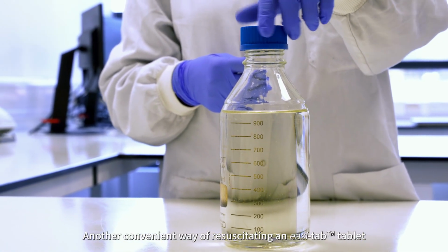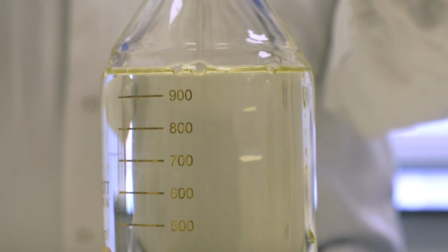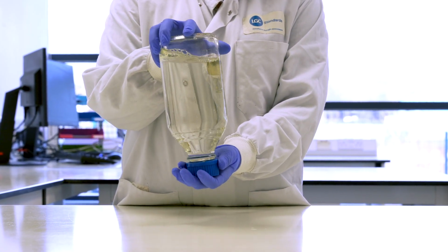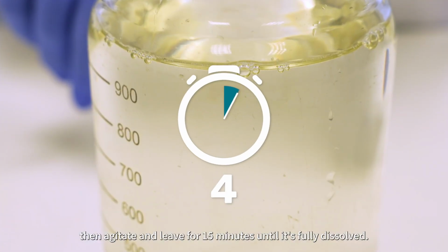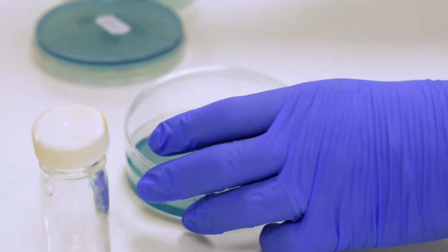Another convenient way of resuscitating an easi-tab tablet is to add it directly to any larger volume of liquid that suits you. For example, you can take 1 litre of diluent, add the tablet directly, then agitate and leave for 15 minutes until it's fully dissolved. This can now be used with agar plates or membrane filtration in the same way.